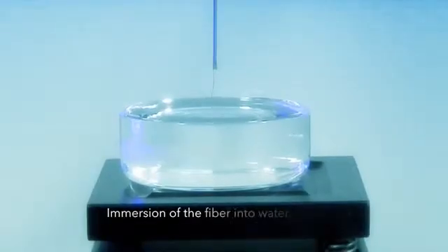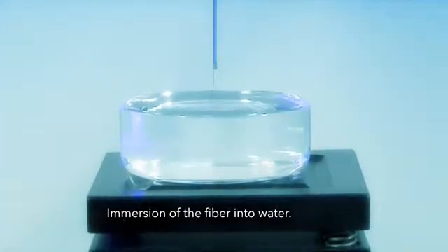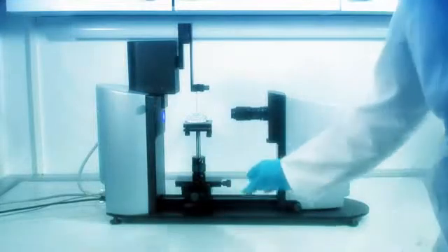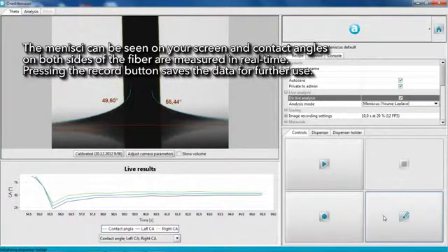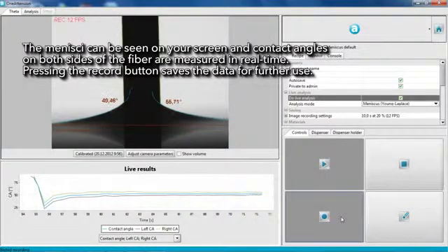Then the sample stage is adjusted. The fiber is then immersed into the liquid sample. The meniscus can be seen on your screen, and contact angles on both sides of the fiber are measured in real time.